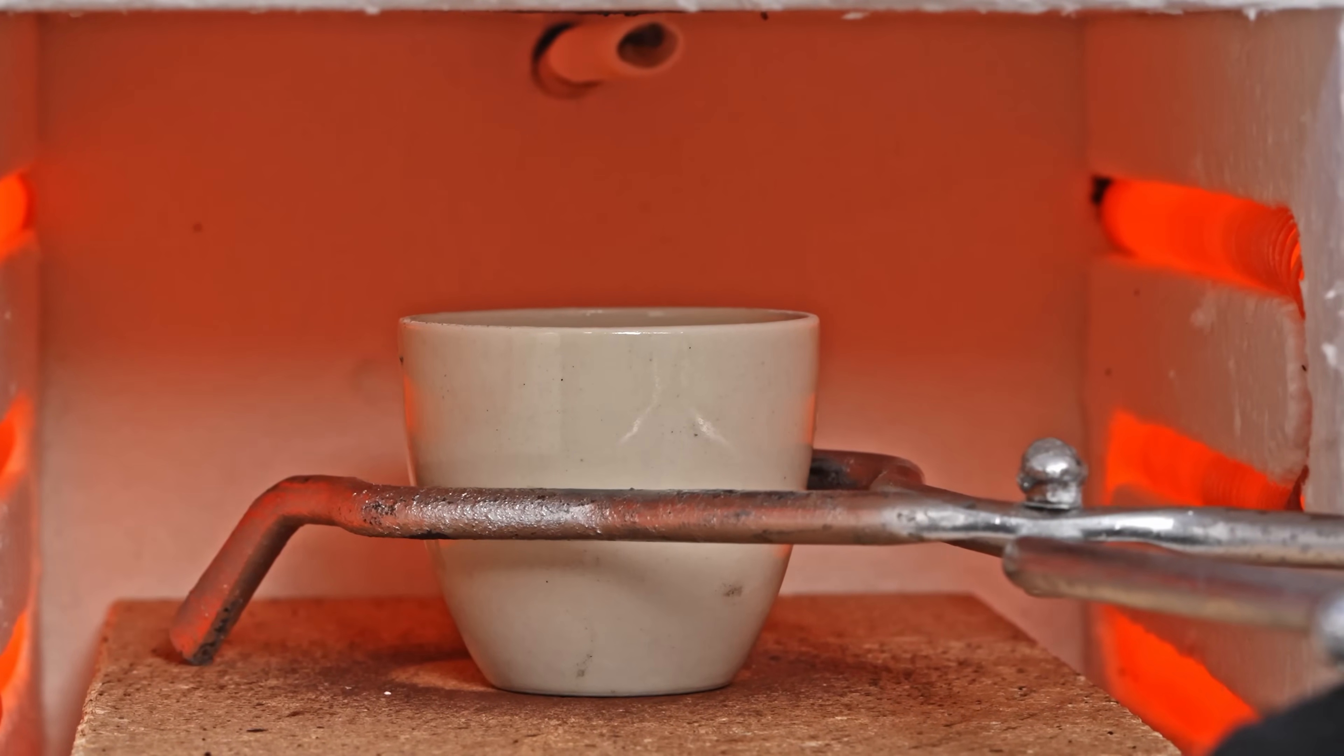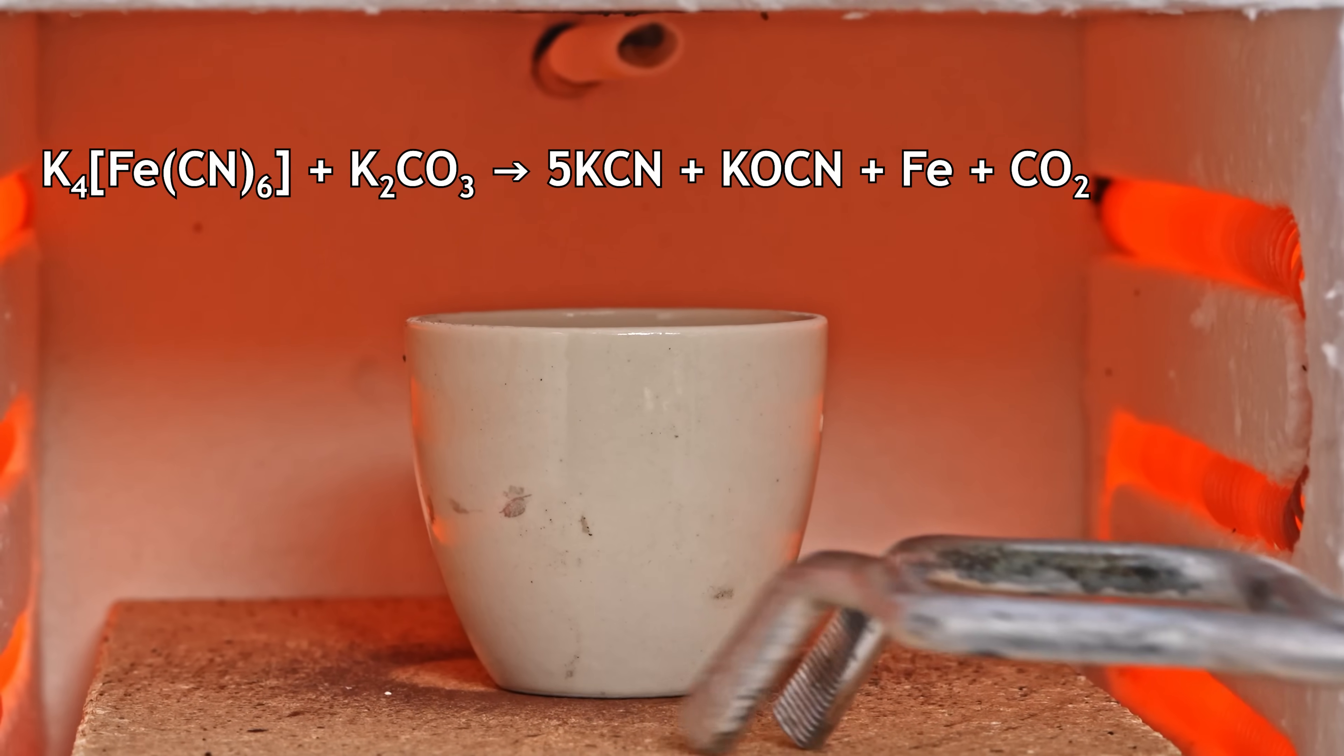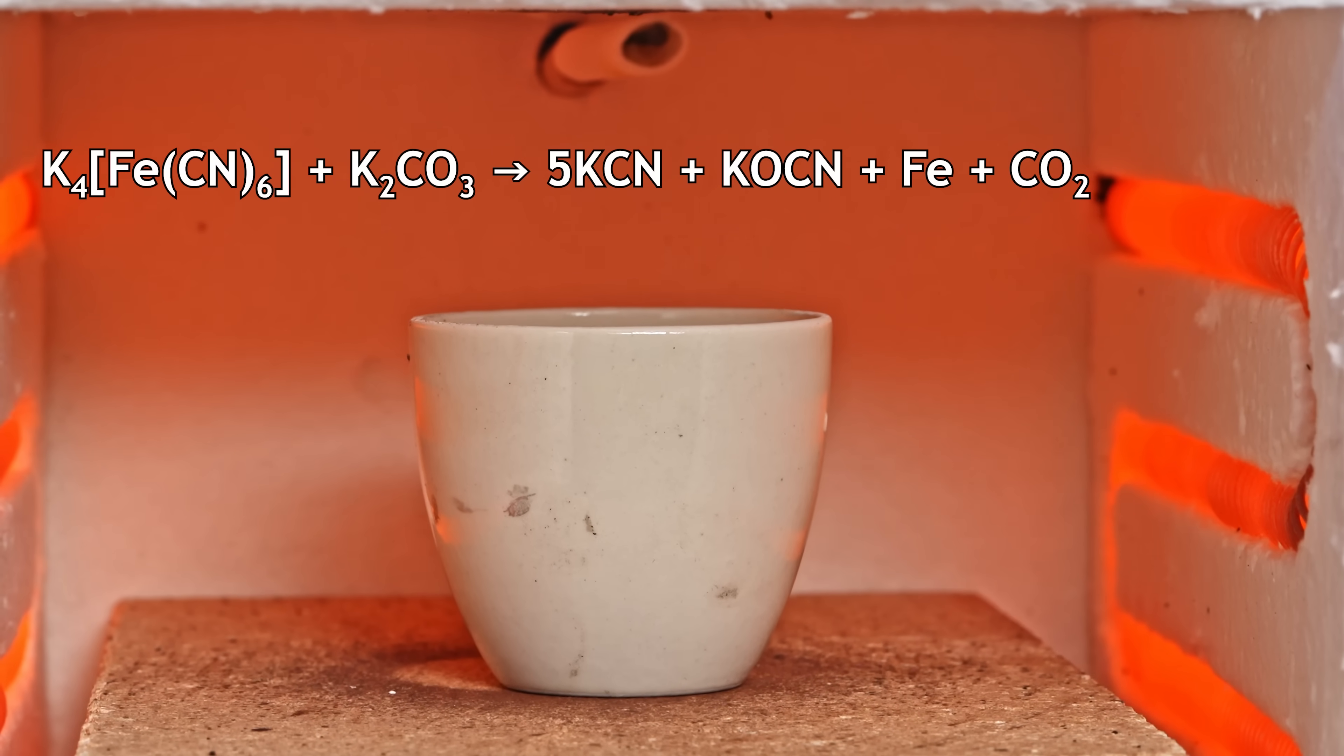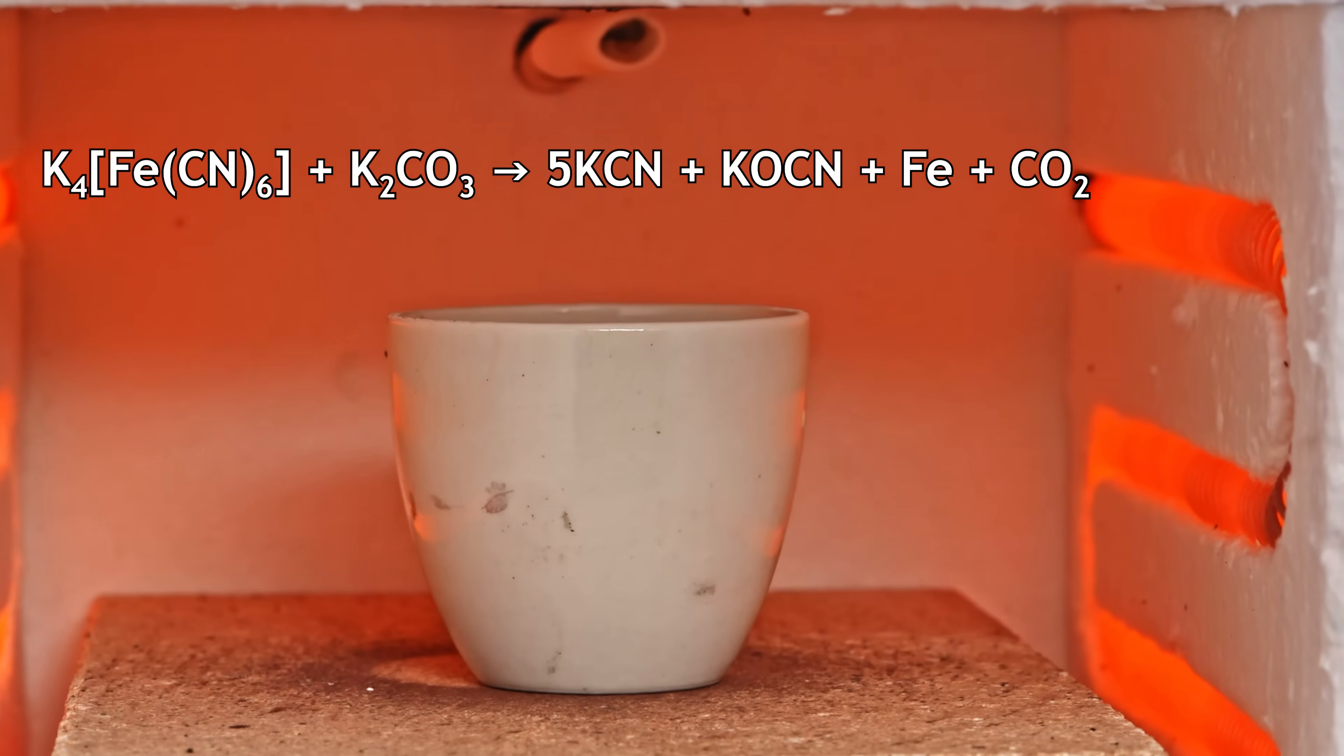At this temperature, a reaction occurs, producing potassium cyanide and a smaller amount of potassium cyanate in a ratio of approximately 5 to 1.